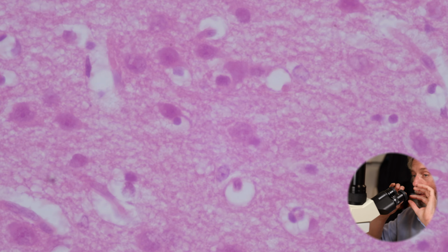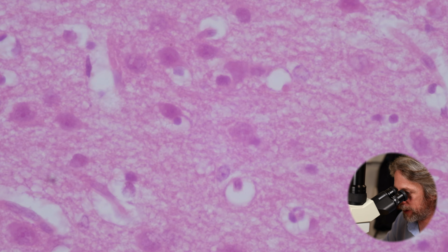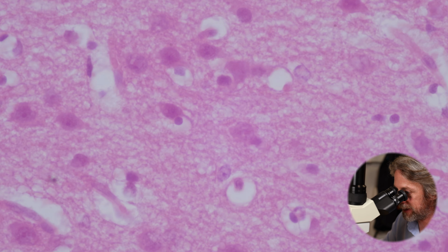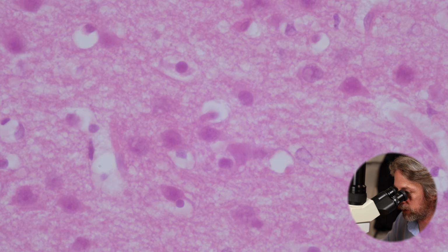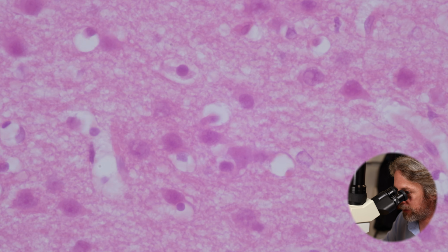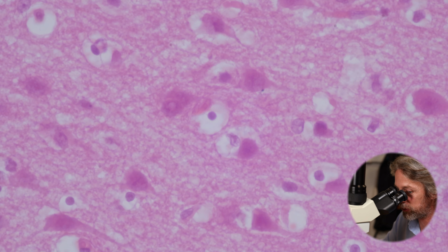And then you've got the neuron cell body, and then it's going to send its axon off, and when it gets into the white matter, it will become myelinated. And it's the oligodendrocytes that are going to myelinate these axons. Now, the oligodendrocytes are identifiable because they look like a fried egg. They've got a lovely round nucleus, and then they have usually pretty round cytoplasm, which appears clear to us.